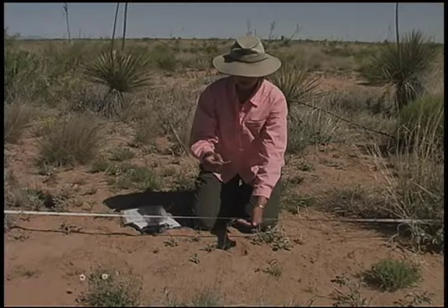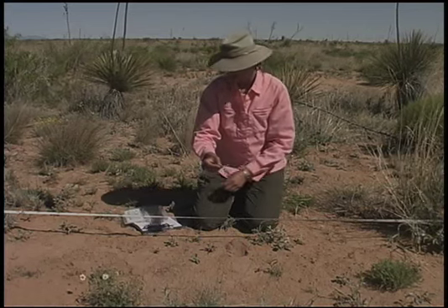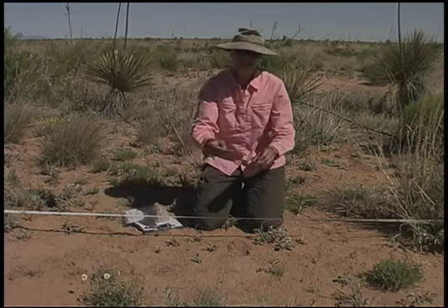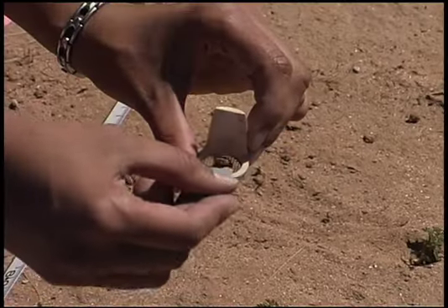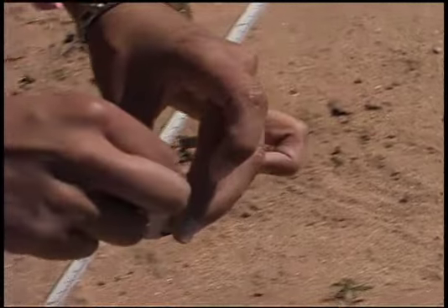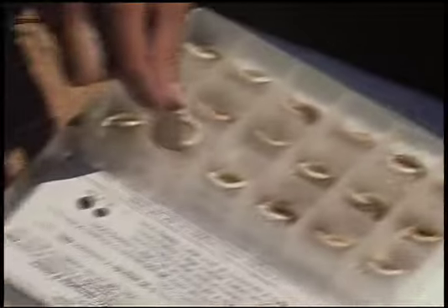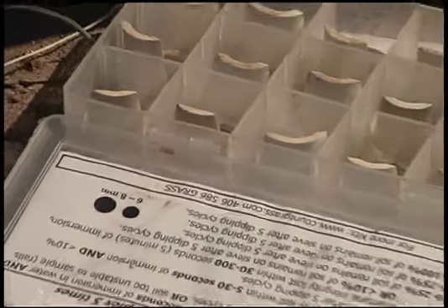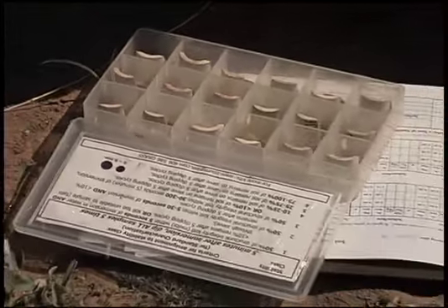Once the fragment is the correct size, take a dry sieve from the box and gently slide the sample into the sieve and place it back in the box. It is important to always keep the sample upright in the sieve from the time that you sample it until the time that you run it.